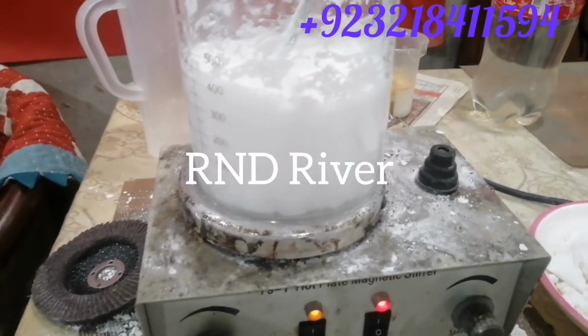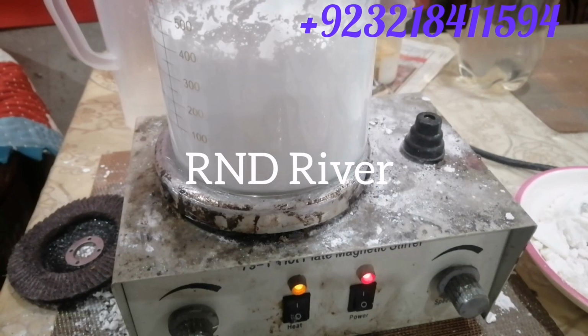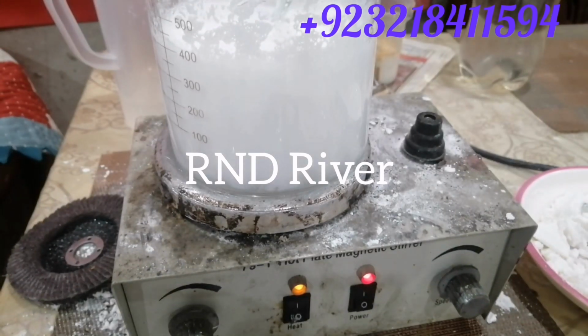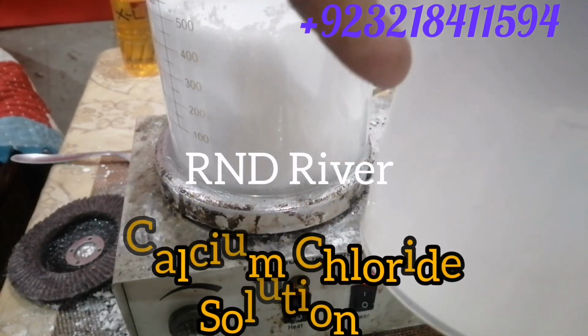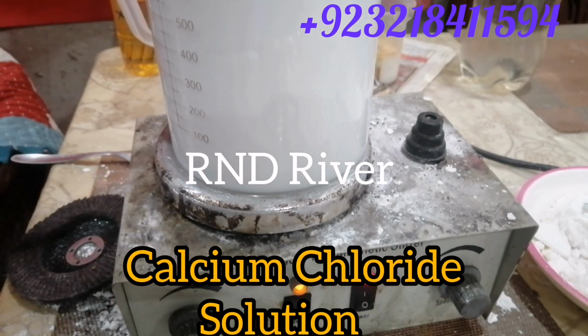As we raise the temperature, the reaction goes faster. Look at the bottom of the beaker. There is a separation of water. It is a sign of every kind of stearate. When you add water, the stearate will separate. It is a sign that the sodium stearate is near to finishing. When you see the water level is high, then add the solution of calcium chloride. Now we are adding the calcium chloride solution.